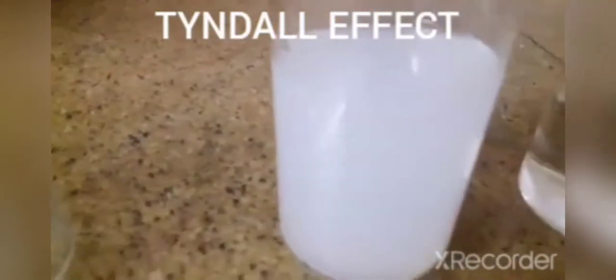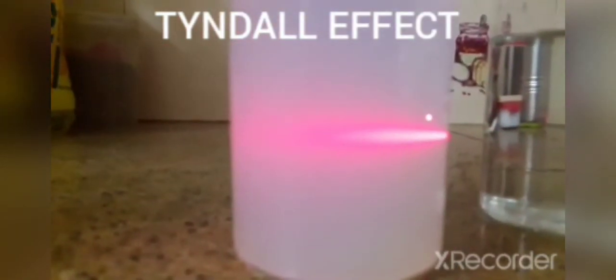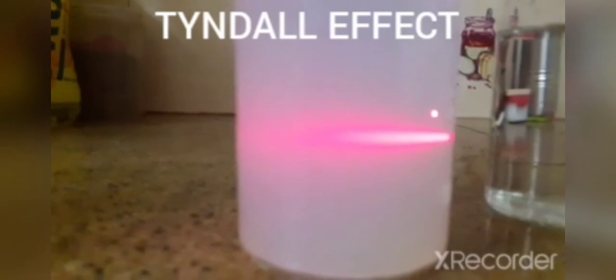And the third one is milk. Now, we all know that colloids can scatter light, and we can see the visibility of the path of light, so there we go. And yes, we can see how light has gone from this side of the beaker to the other, so therefore we'll mark it as a yes.